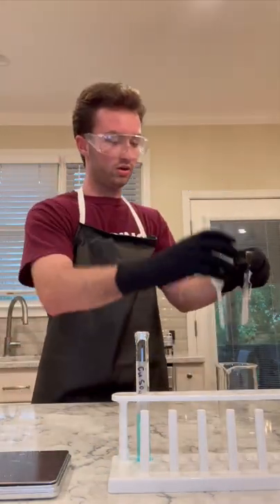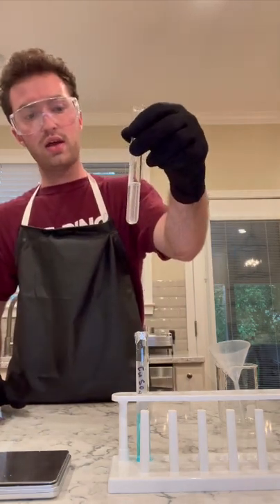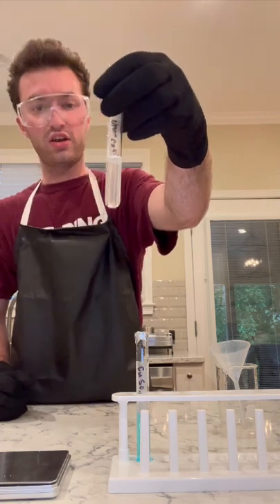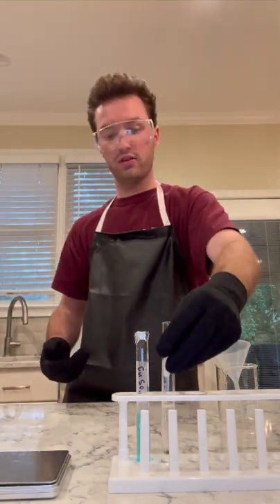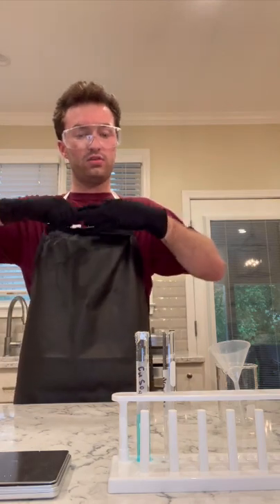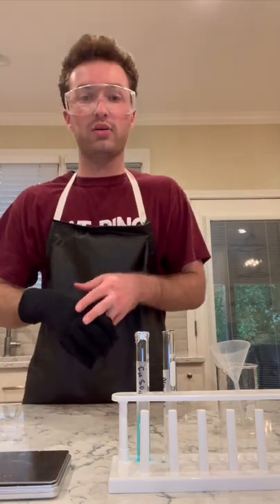Video. Just wanted to give you a quick look at my Na2CO3. As you can tell, not a lot changed. The water did turn white, just off physical appearance. So I'm going to properly store that with some aluminum foil, and I'll be back for my next preparation.